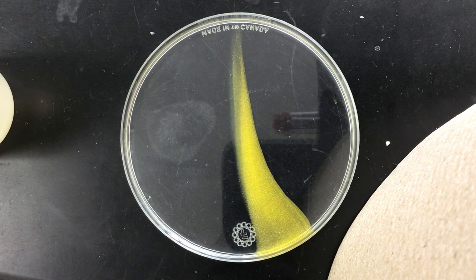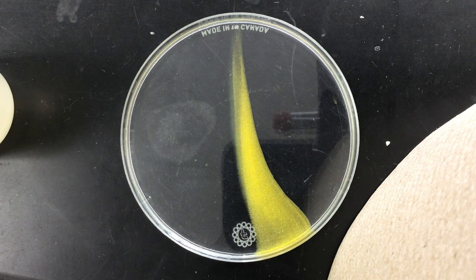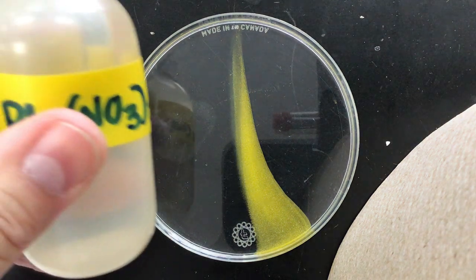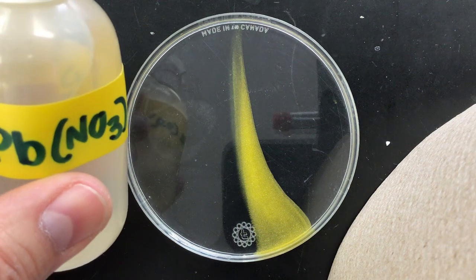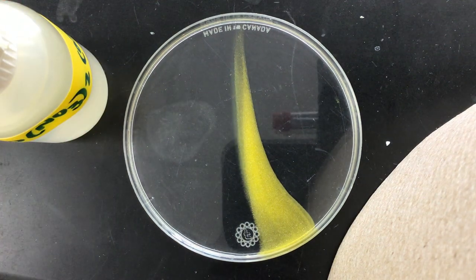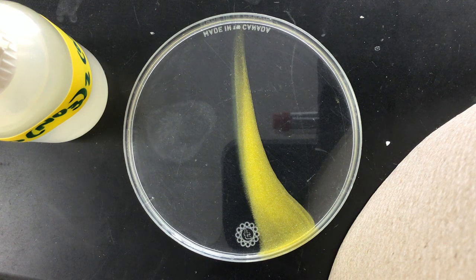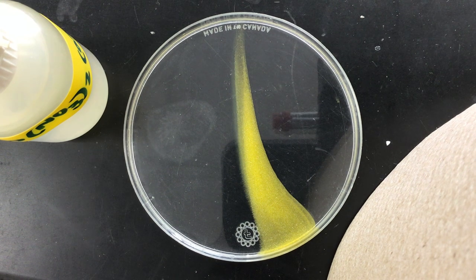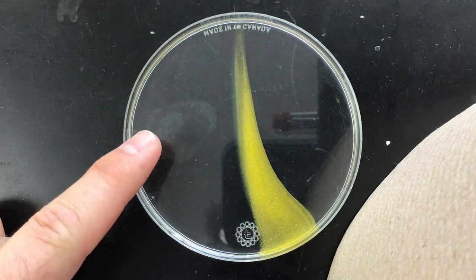All right, let's test the theory we came up with in the modeling activity — that maybe some of the lead nitrate we added on the left hand side possibly made its way over onto the right hand side, and some of the potassium iodide we added on the right maybe made its way over to the left.